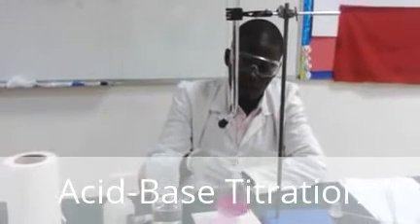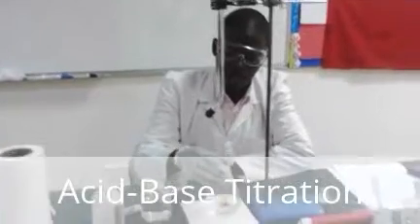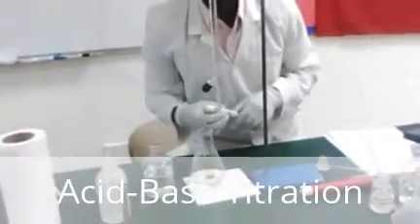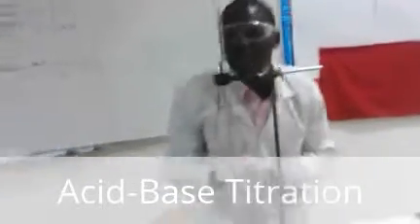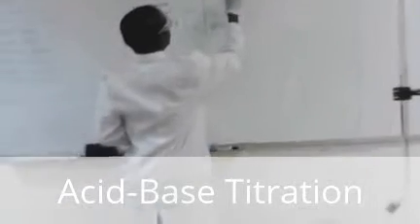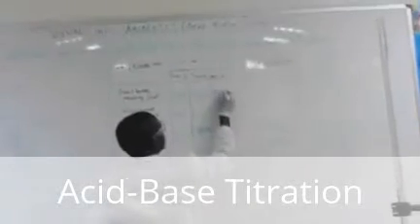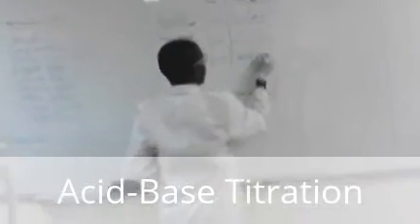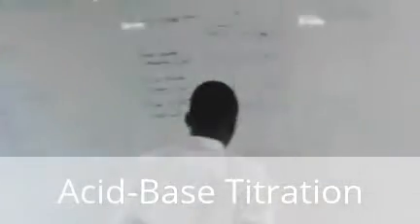I go slowly. Stop. So this is a colorless solution. I record. Now this time it is 28.6. So my initial was 0.00. Final it is now 28.60. So the volume of hydrochloric acid used is now 28.60. So now I'm done with my titration. Now this is ready for cleanup.